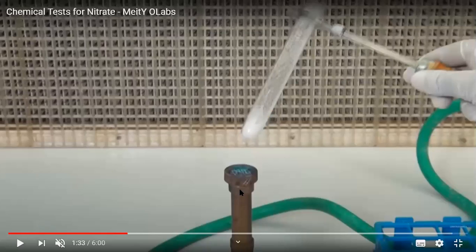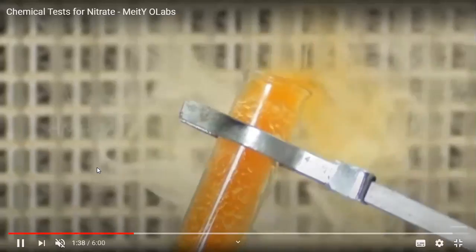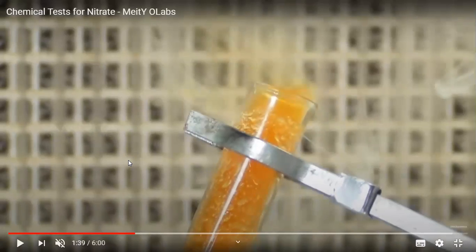Now we are going to heat the salt on the Bunsen burner, and let us observe what happens. Dear students, can you see what happens? What have you observed? Can you tell me, please? When we heat the given salt, what happens?